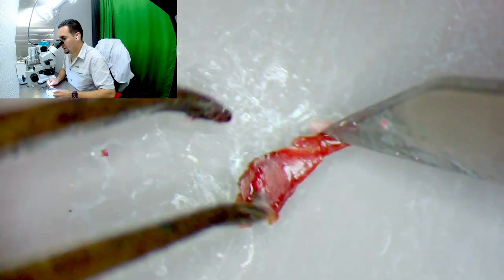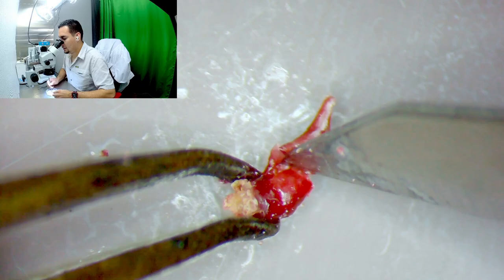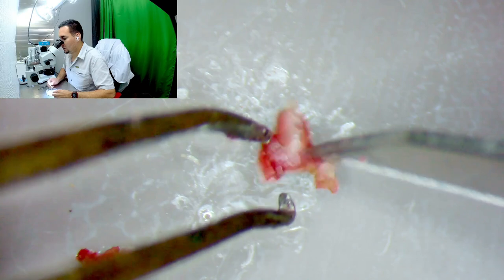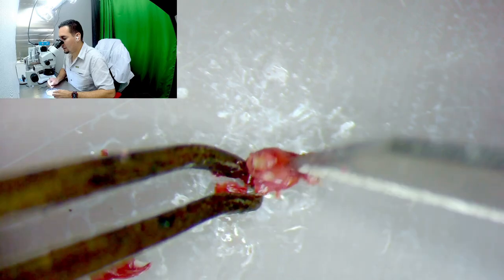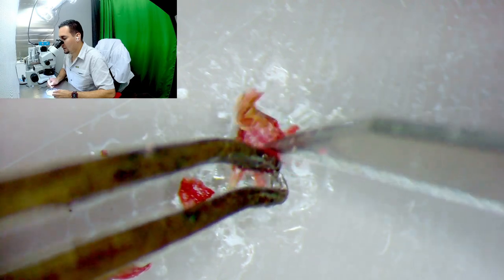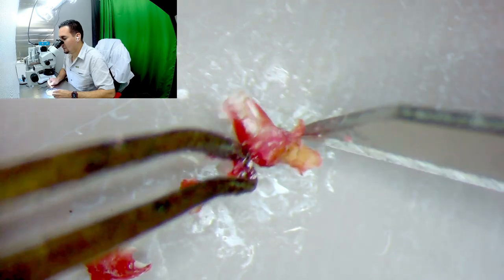I'm getting close to the point where I will set aside the forceps and use two scalpels. For me it's kind of difficult to grab it with the forceps because — as you can see — they look too big. And you already know the apical meristem or shoot tip is really, really small.